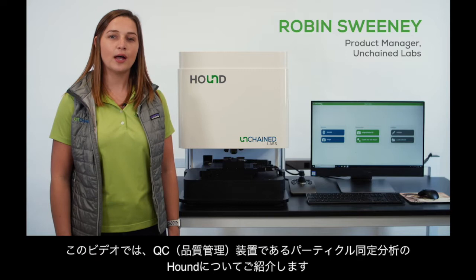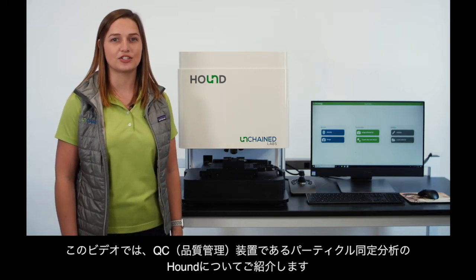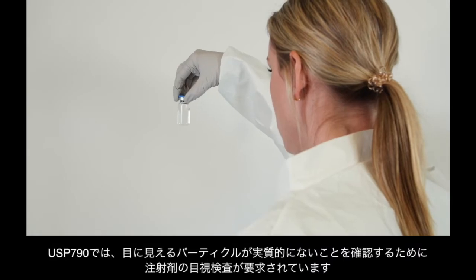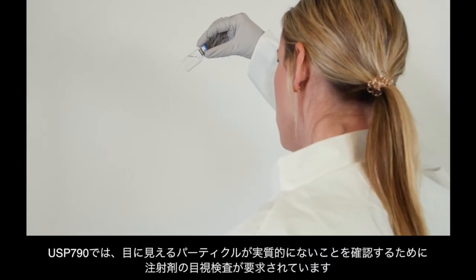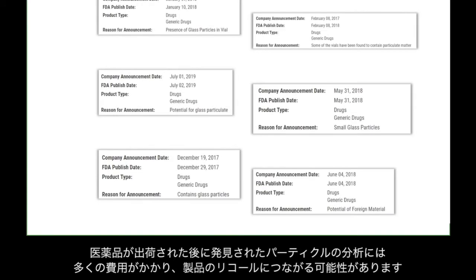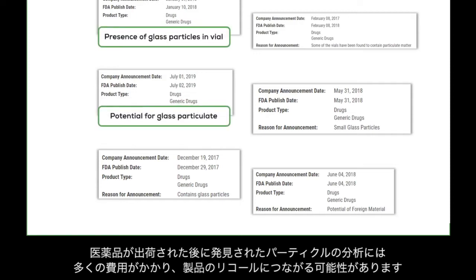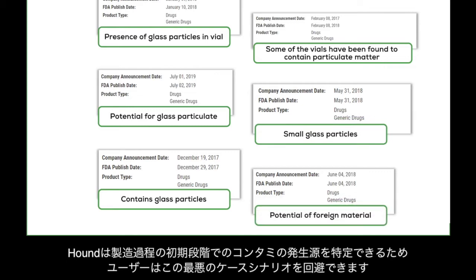In this video, I'm going to show you Hound, our QC instrument for particle identification. USP 790 requires the visual inspection of injectable drugs to ensure that they are substantially free of visible particles. Particles spotted after a drug has been shipped can lead to costly and highly visible product recalls. Hound identifies sources of contamination early in the manufacturing process so that you can avoid this worst-case scenario.